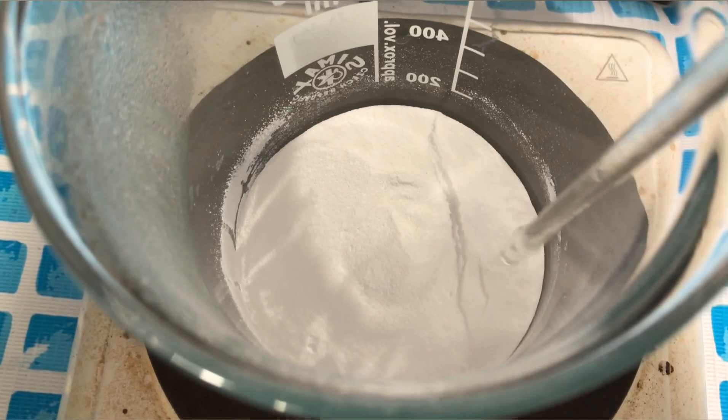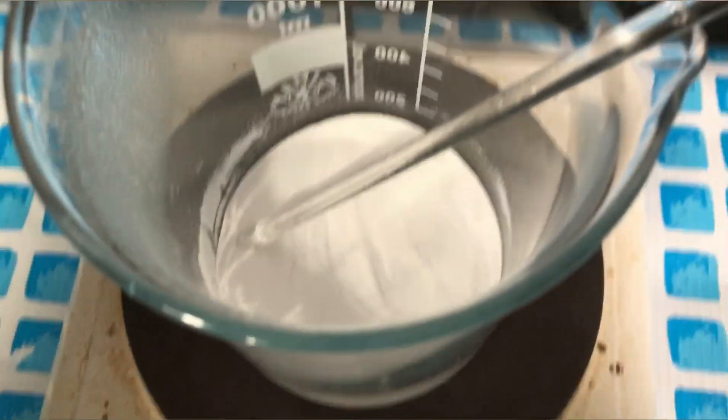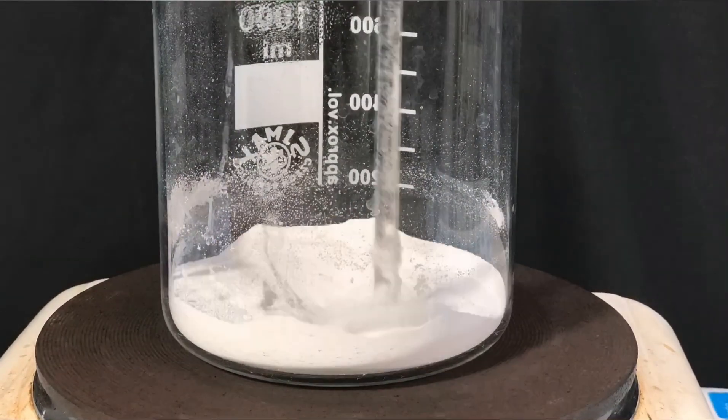If you look closely you will actually see some bubbling as if the sodium bicarbonate was a liquid. If a Bunsen burner however is used, the bubbling will become even more evident.